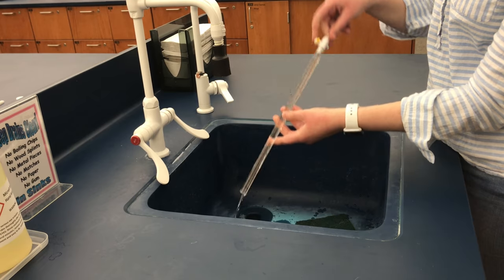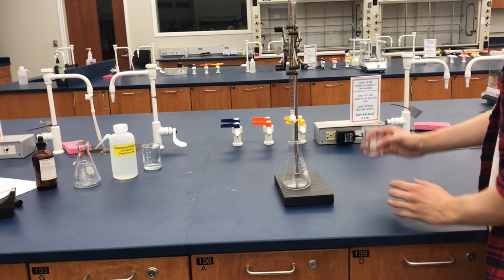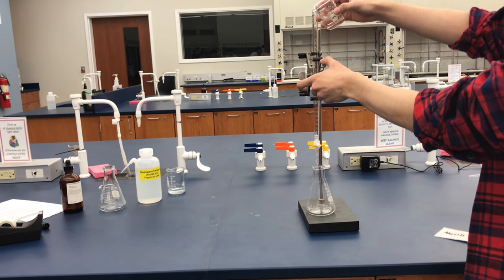Rinse the burette with deionized water and then pour in the known solution, being careful to not fill above the zero line.